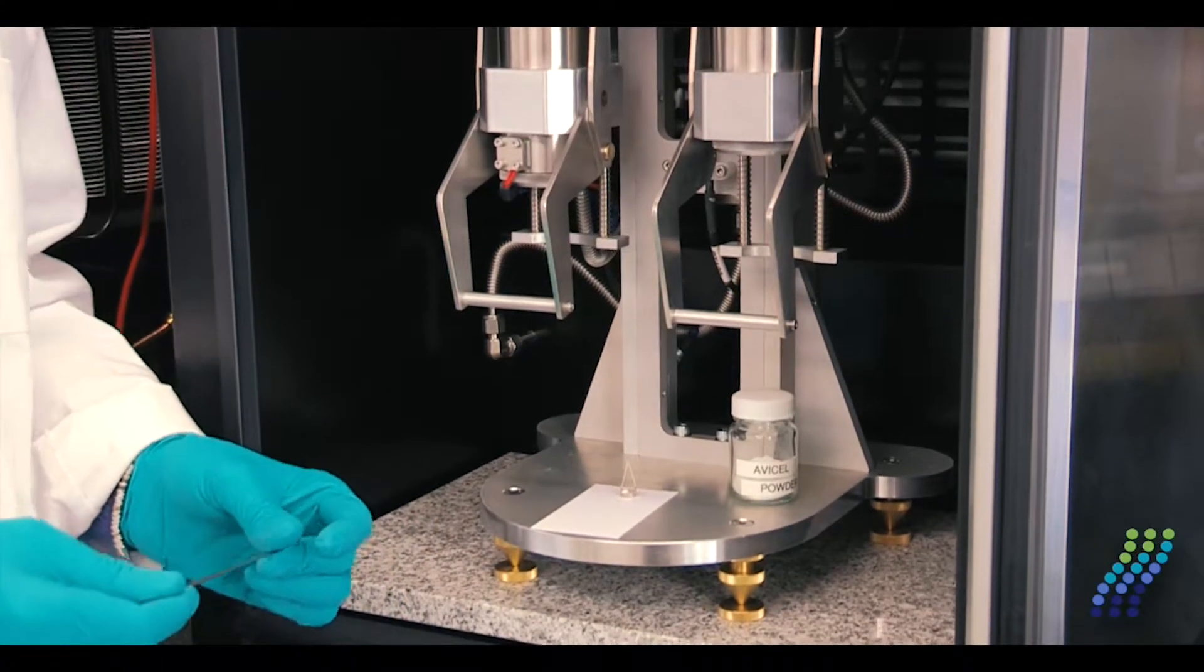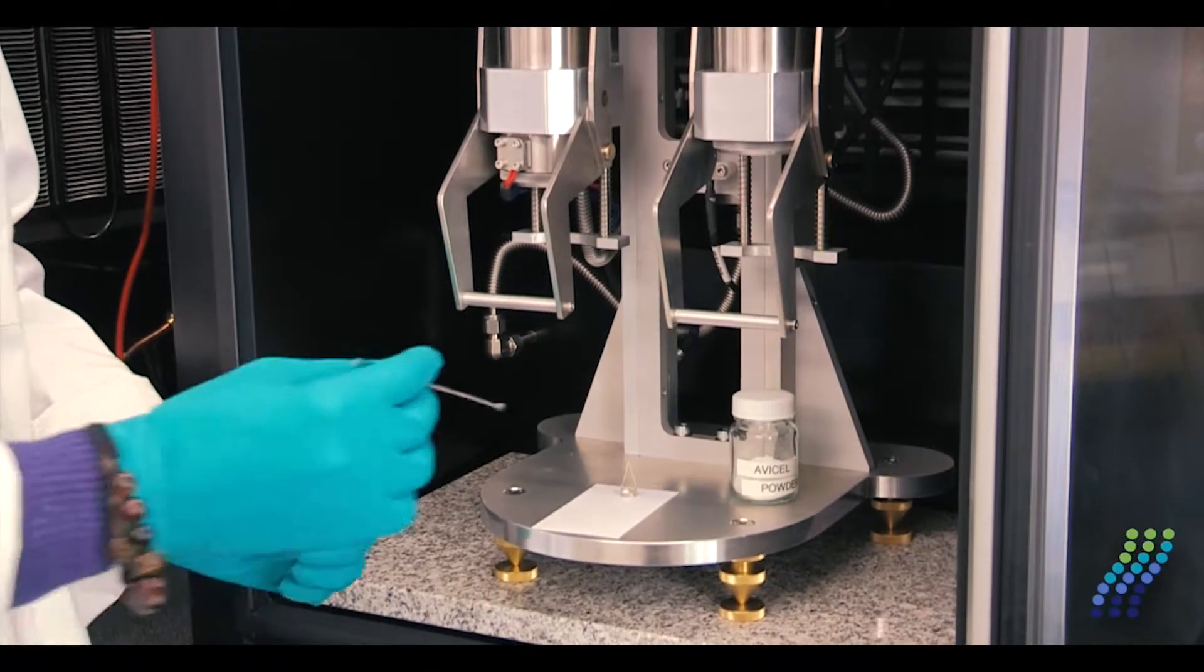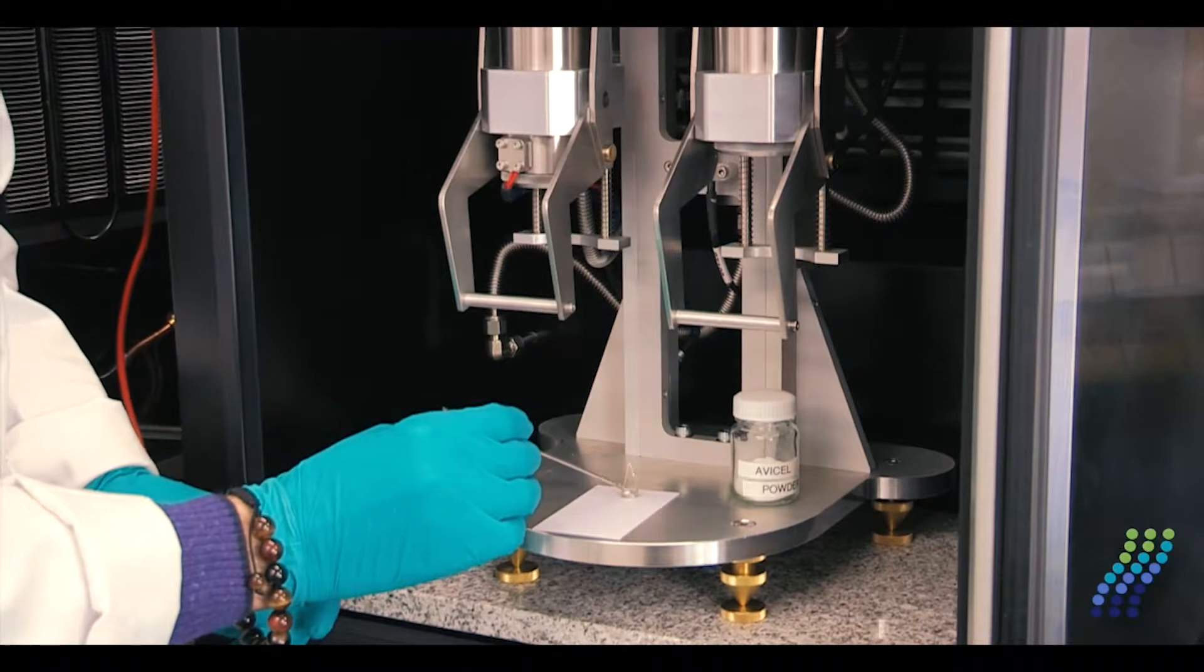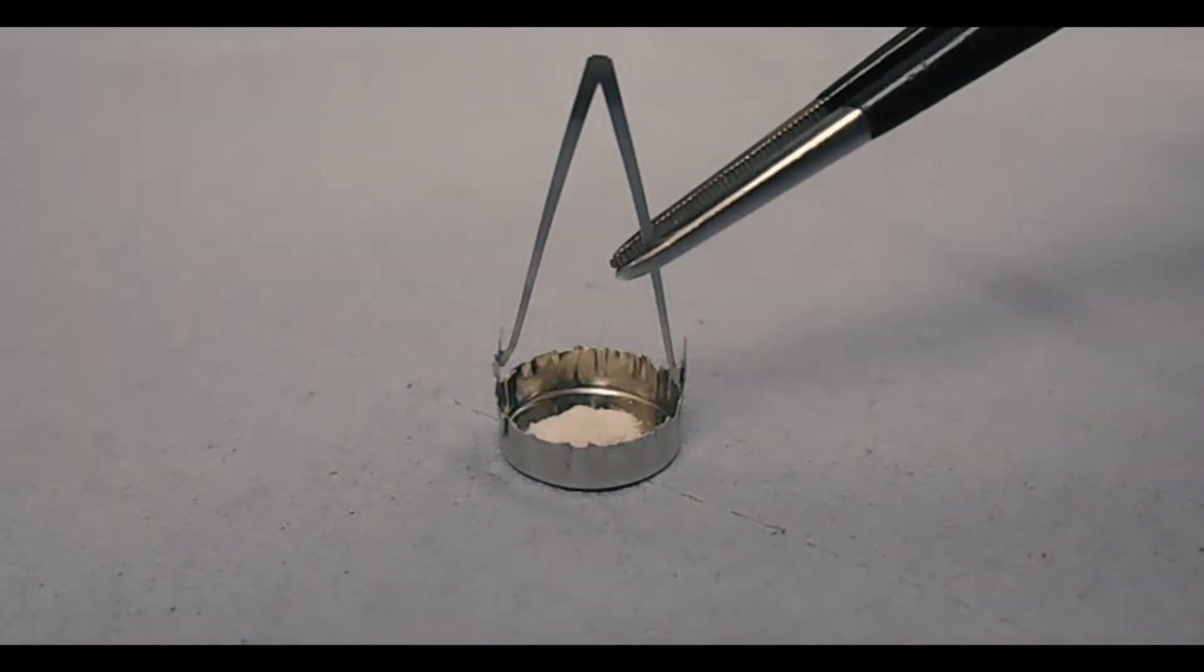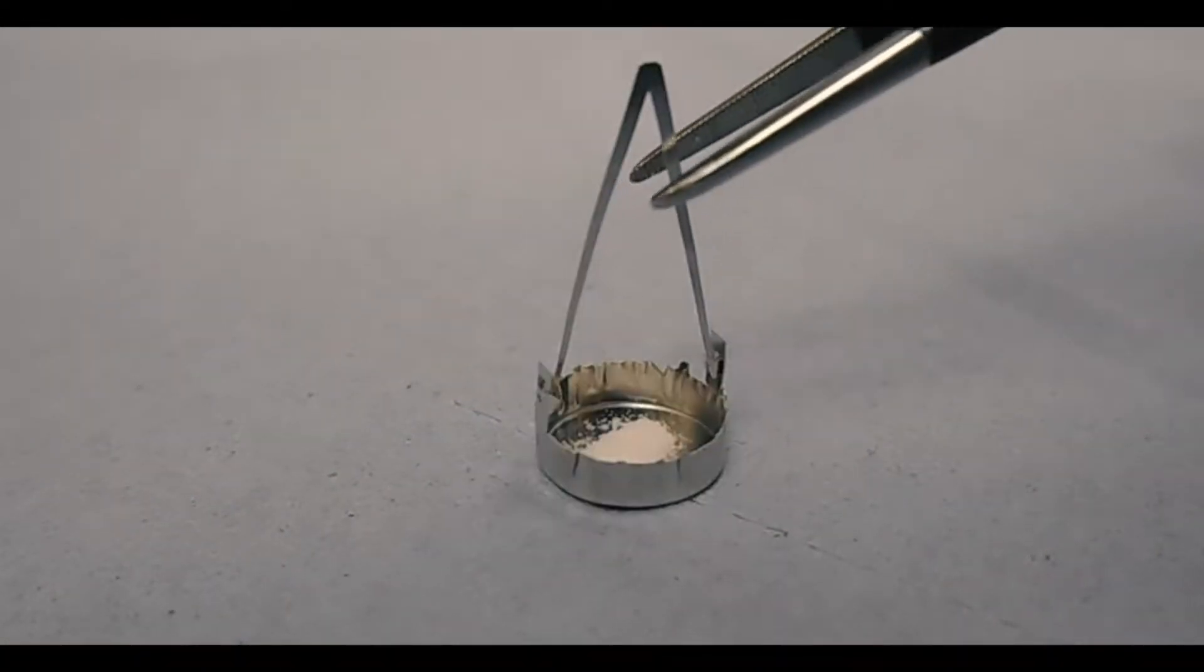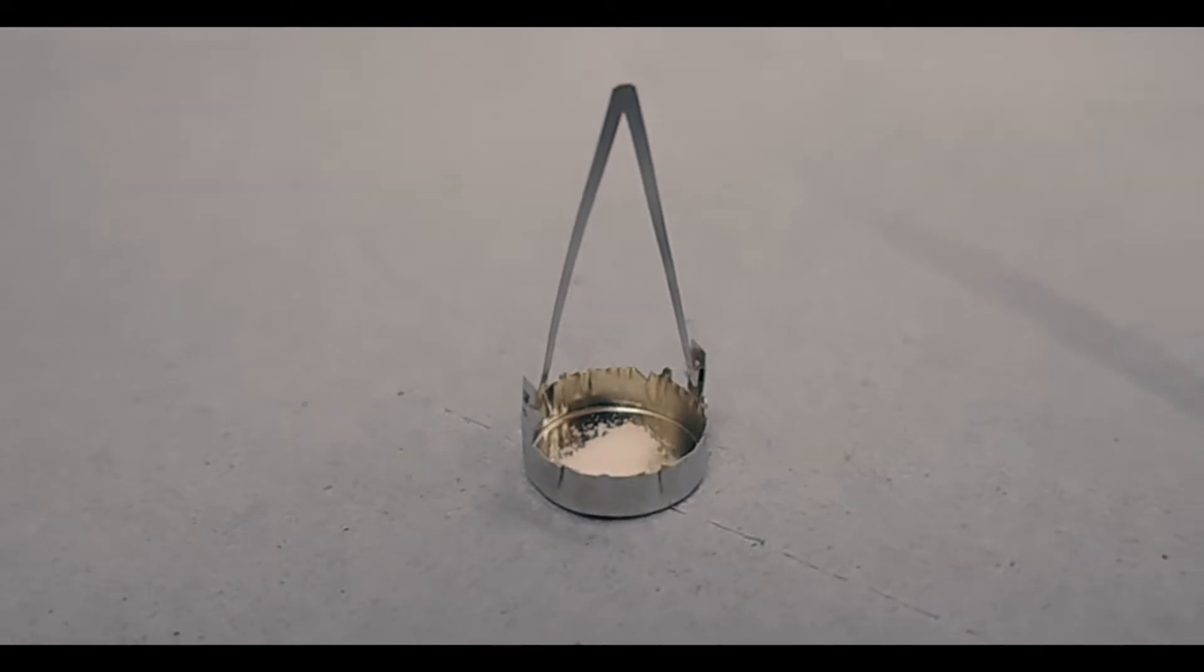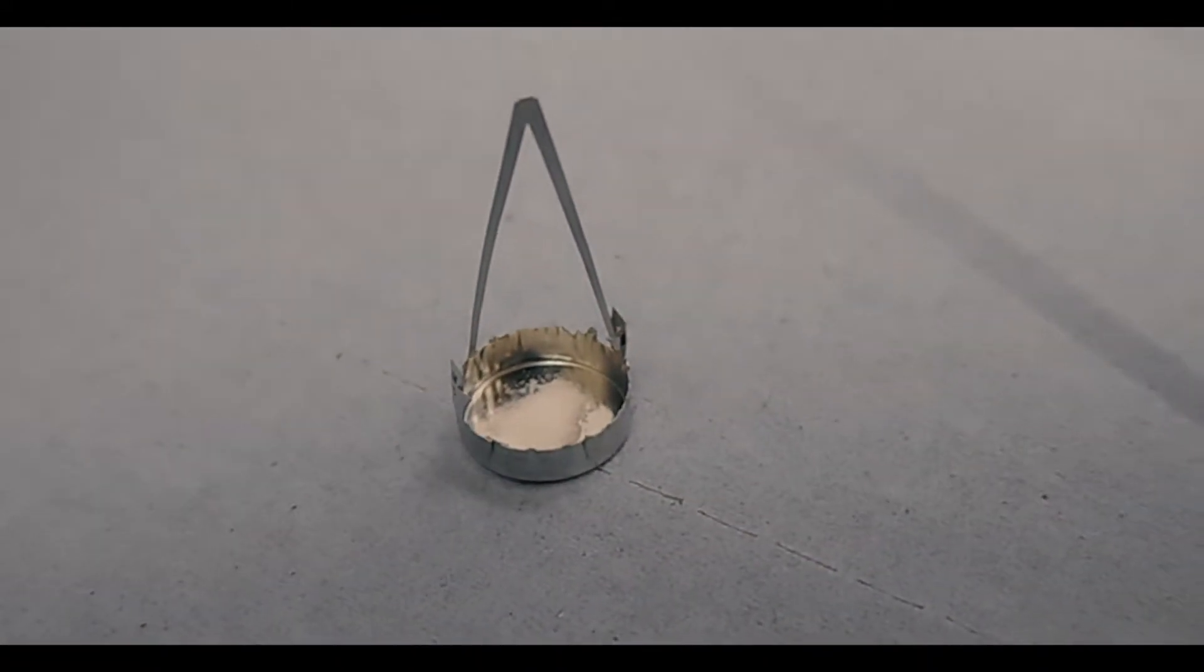Now I spread the sample across the surface of the pan by gently tapping it, so it offers a higher surface area for absorption.